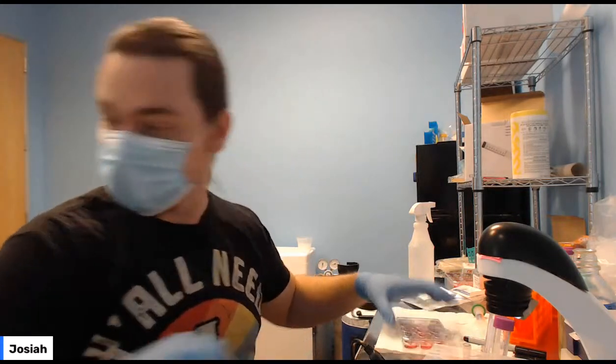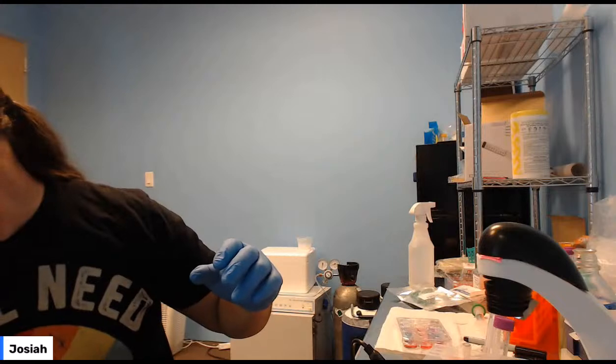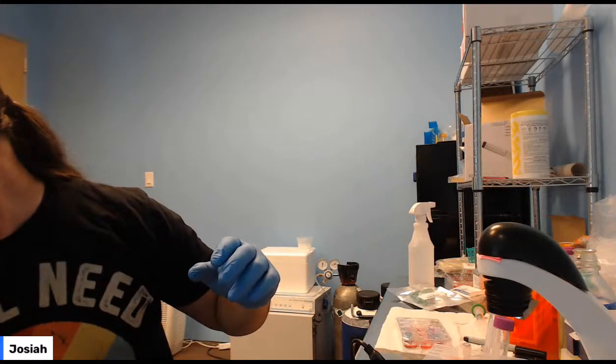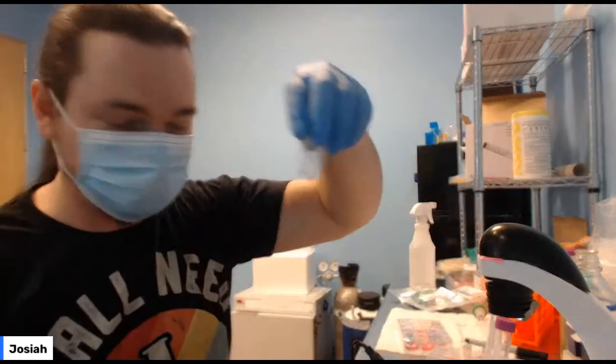Okay, so those are changed. I've got 10 seconds left on my timer. Let me go ahead and stop it. Okay, so now these are ready to go.